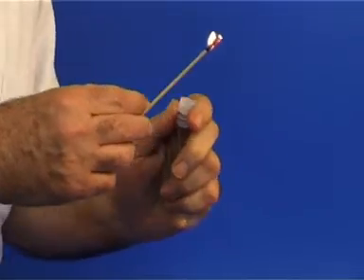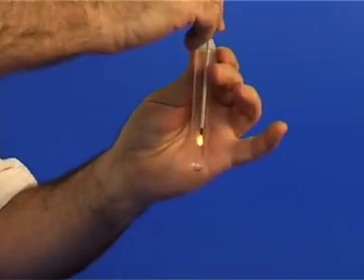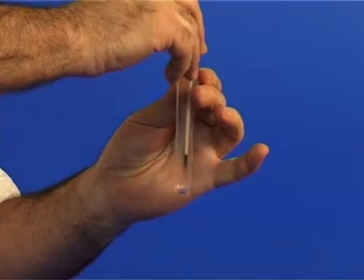To detect oxygen, ignite a splint, extinguish it, and insert it immediately into the oxygen test tube.